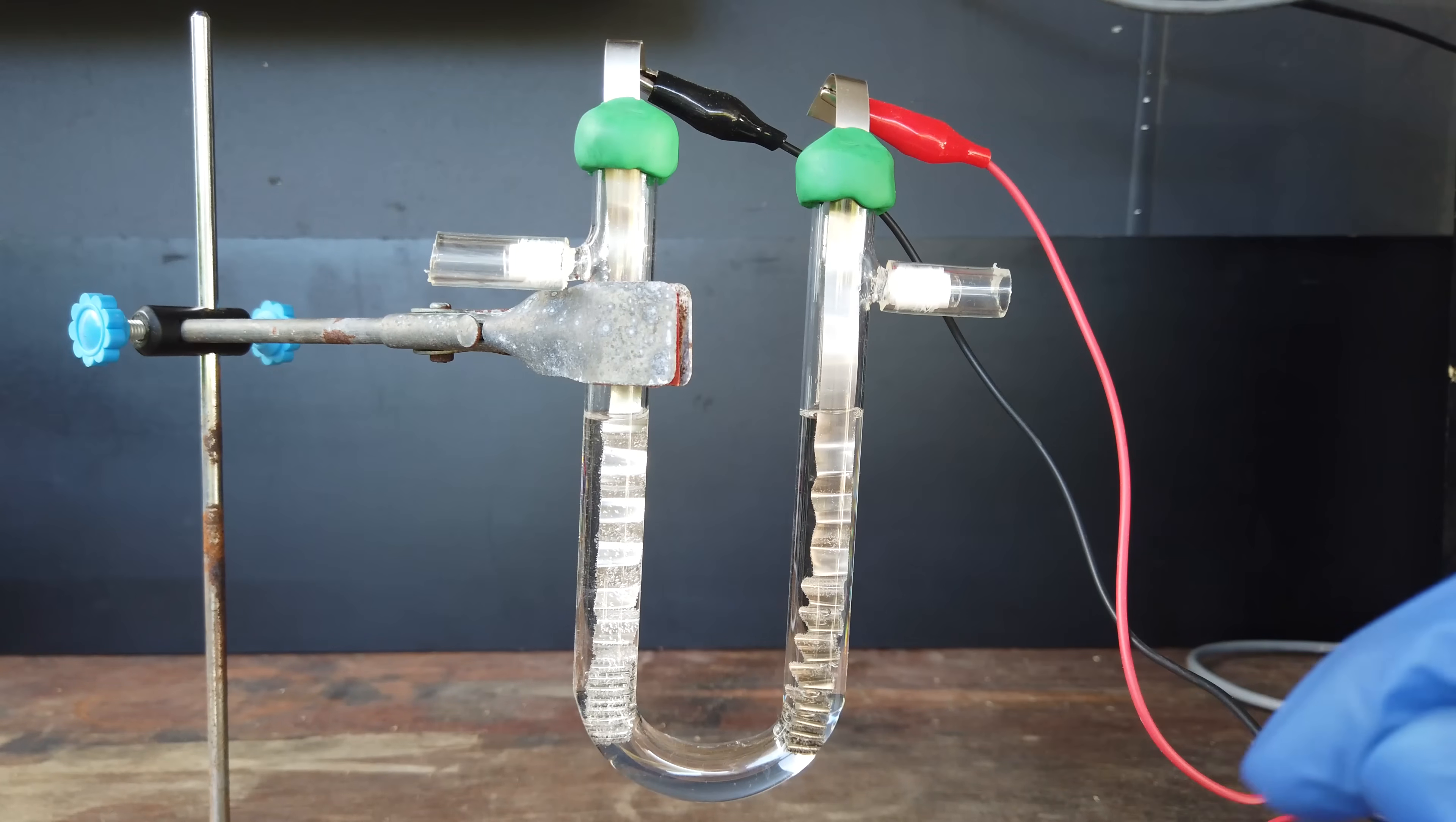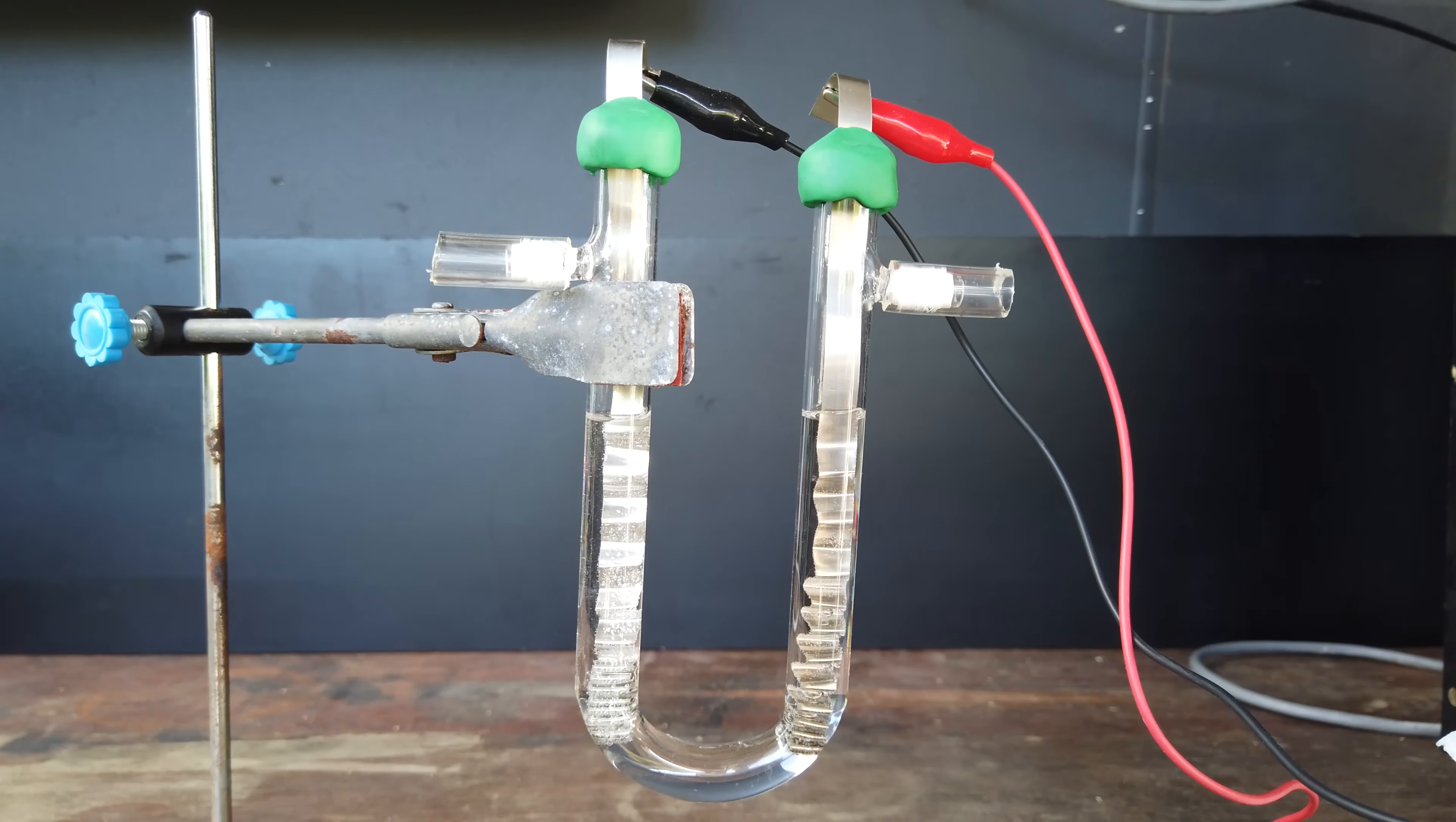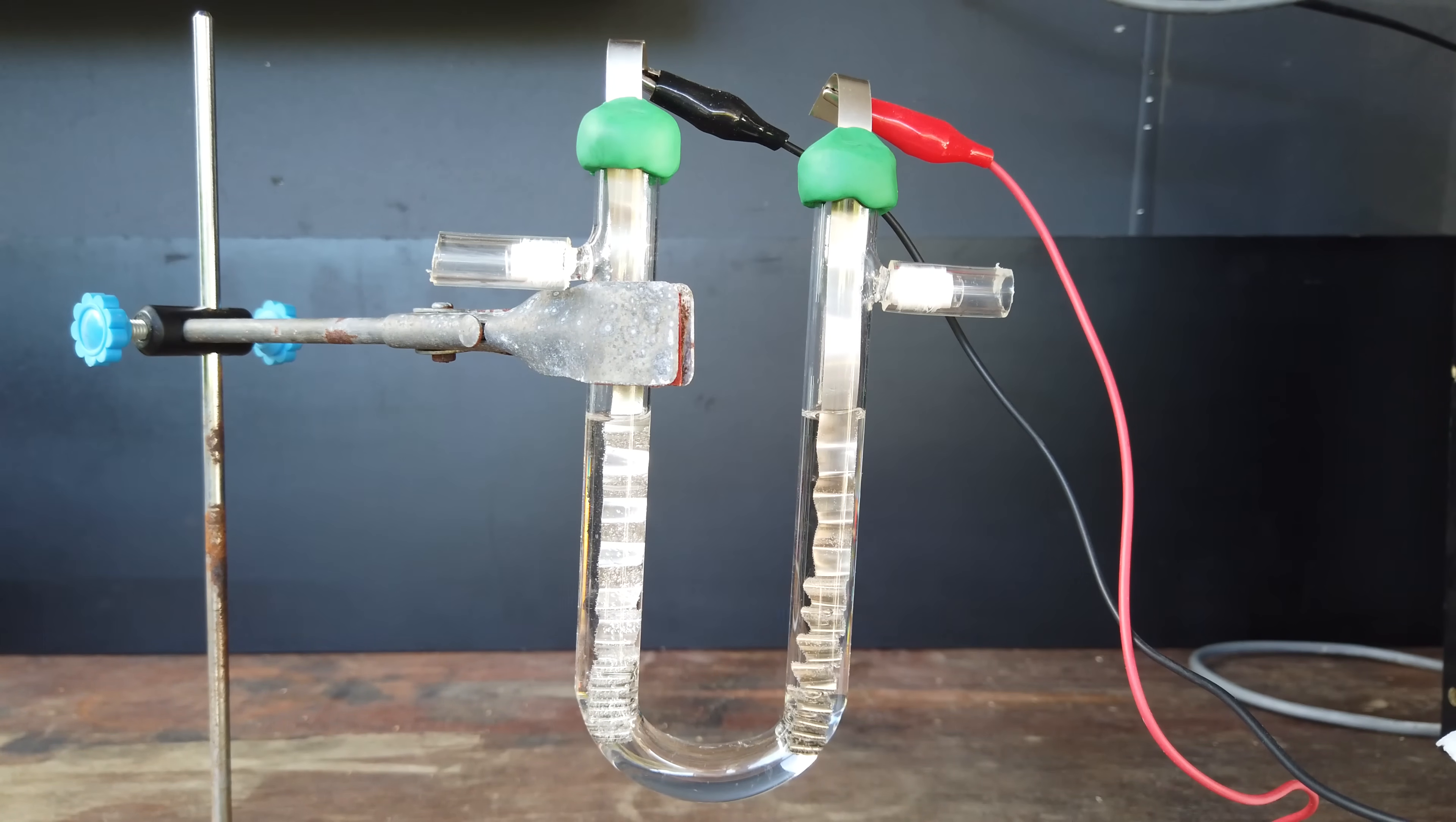And that's something I don't want to do because I actually want to collect the nitrogen and demonstrate that it is nitrogen gas that we're making here. If we run our electrolysis at 1.5 volts, according to a paper that I read recently about this process, the anode gas containing mostly nitrogen will only be contaminated with about 2% oxygen gas, which I think is perfectly all right.